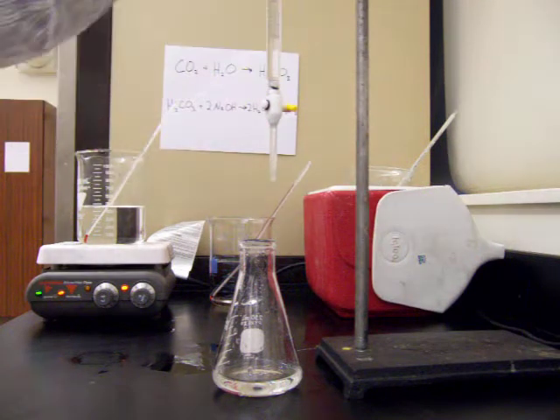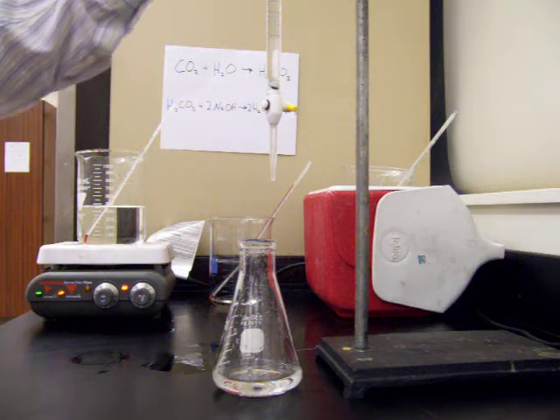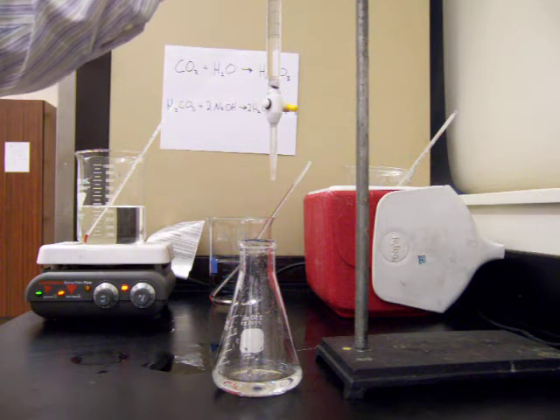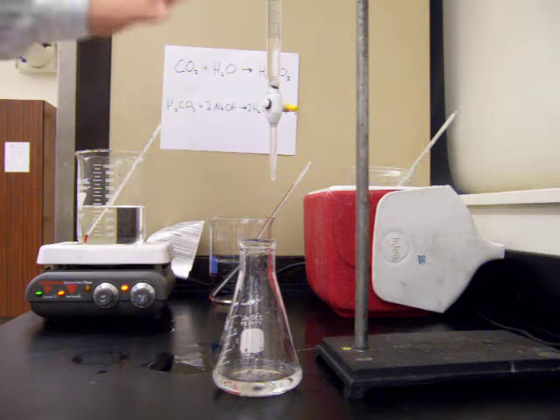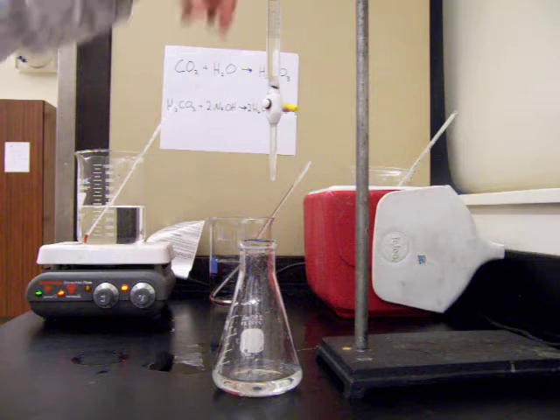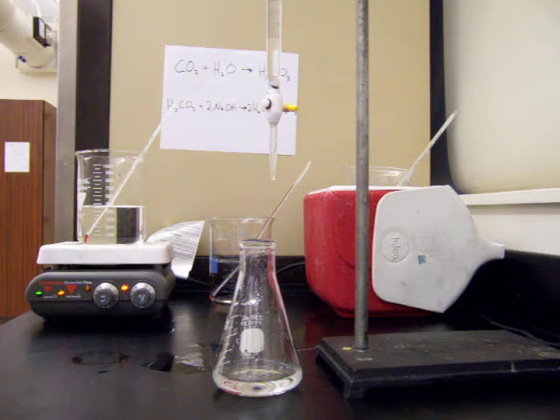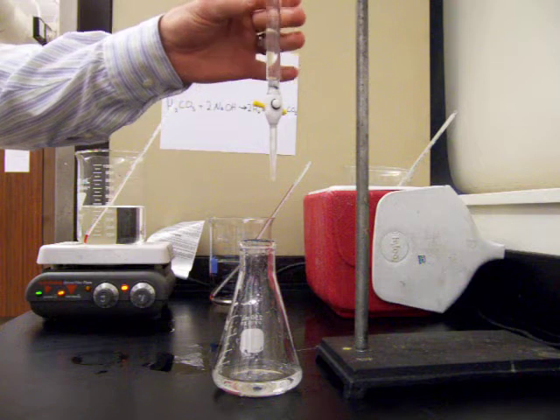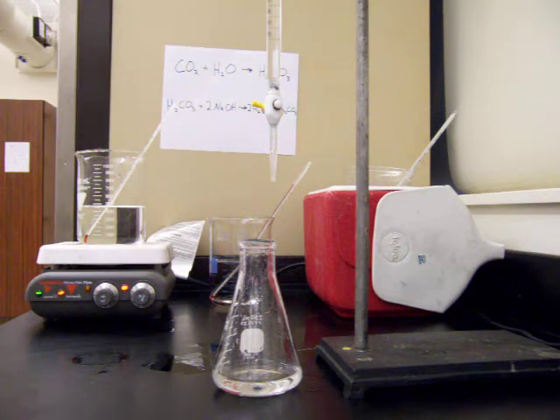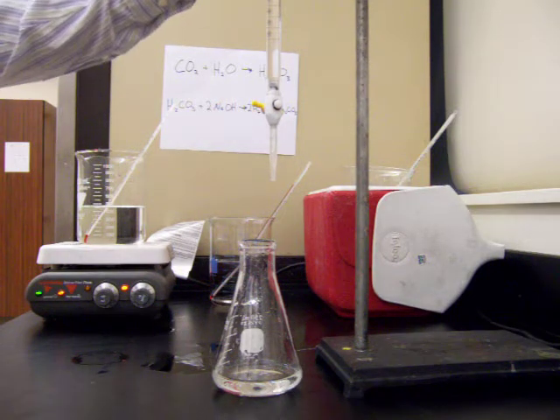Here is our burette filled with our standard sodium hydroxide solution. The sodium hydroxide has a known concentration of 0.2 molar. It's important to know the molarity of the sodium hydroxide — combined with the volume used we can calculate the number of moles of carbonic acid. The starting volume in our burette is 3.6 milliliters.